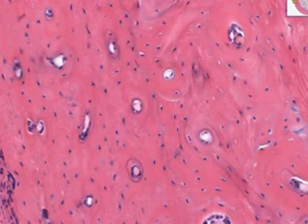Perhaps one more thing I would like to mention is that when you see cells like this, which eventually get trapped up as a concentric ring within the Haversian unit, these are actual osteoblasts. So when an osteoblast is completely trapped within hydroxyapatite, that is then called an osteocyte. Just like when a chondroblast is completely trapped up within chondroid matrix, this goes from chondroblast to chondrocyte. In bone, it goes from osteoblast to osteocyte.